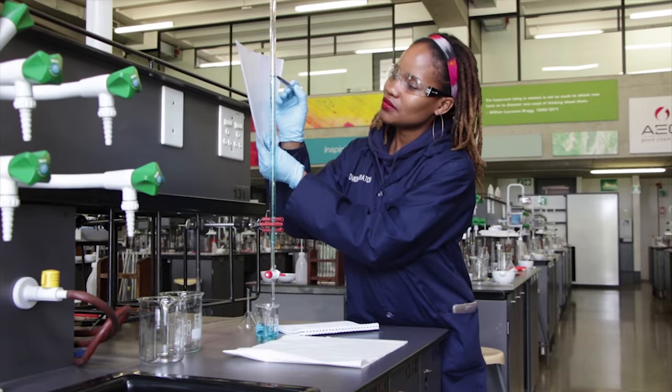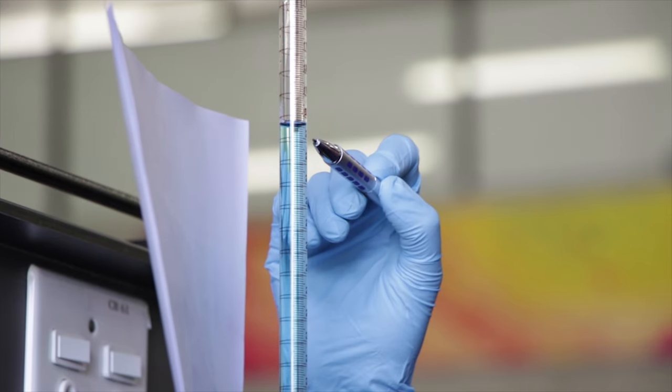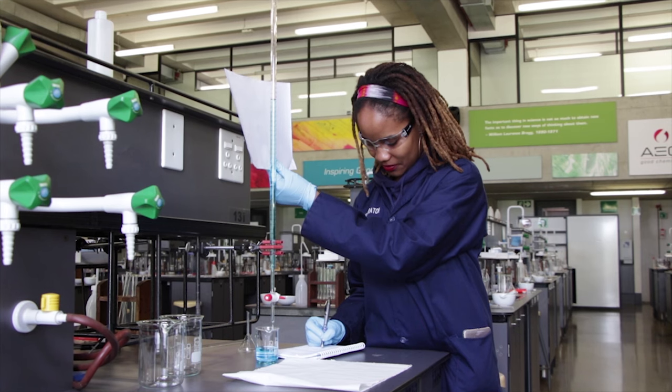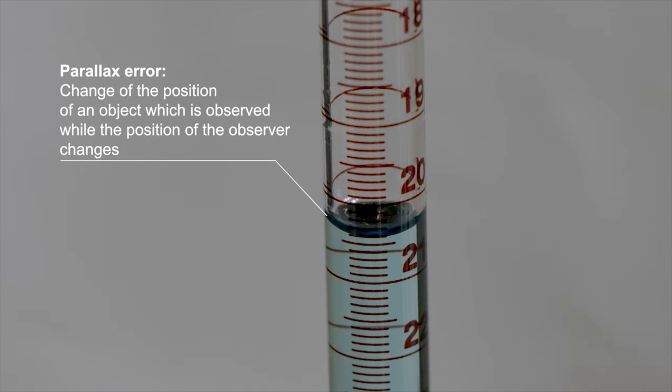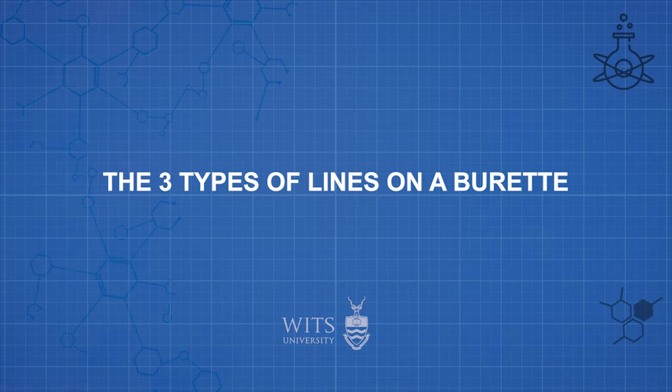When taking the reading of the volume of a burette, make sure the meniscus is at eye level, as reading the meniscus at an angle will result in parallax error. There are three different types of lines used on a burette.